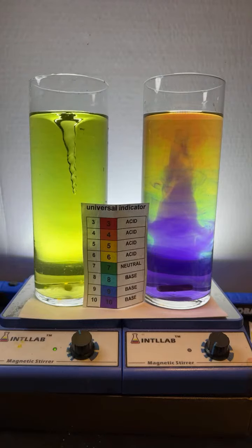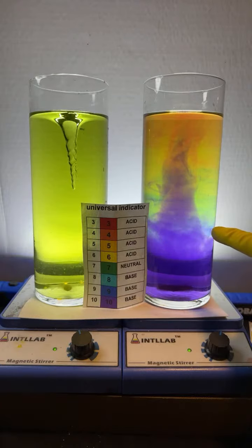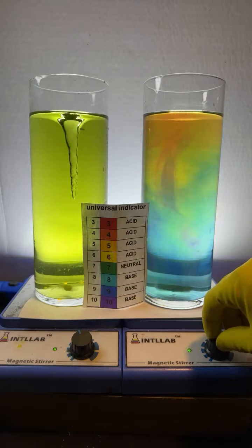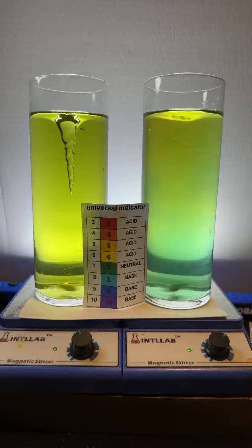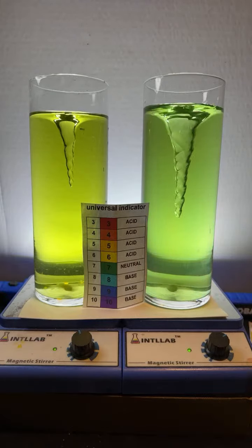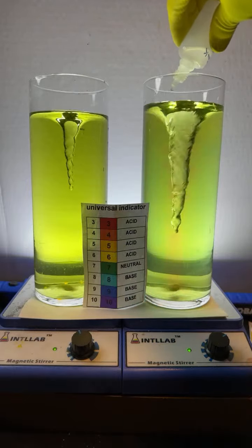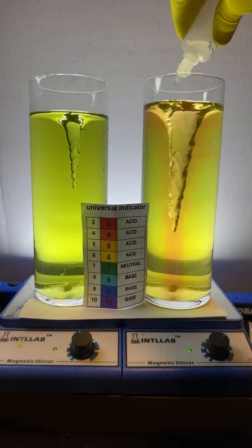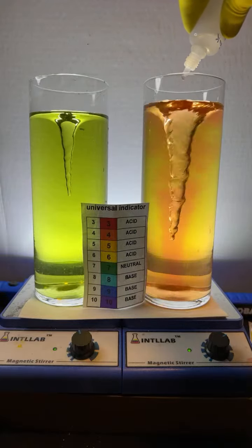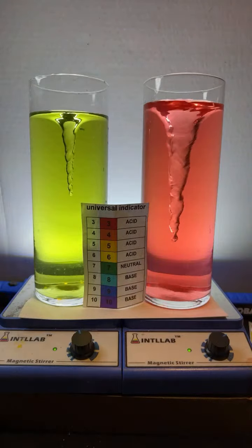Yeah, the purple does tend to be towards the bottom, but here, let's try it the opposite. So this started with purple. I'm going to get this all mixed up over here on the right, and then what we're going to do is make it red to begin with. So I'm going to add a bunch of acid over here to make this acidic. For some reason, my acid does not seem that concentrated. Okay, we've got this acidic.